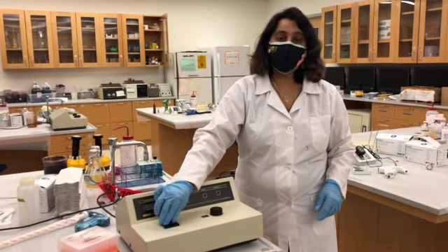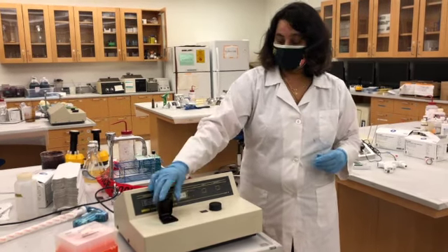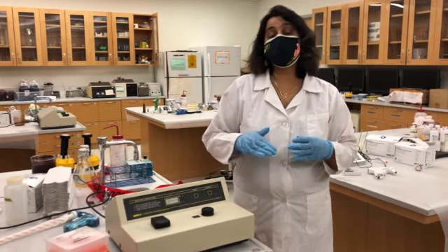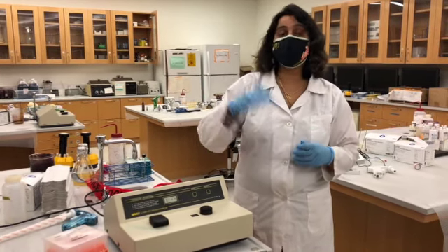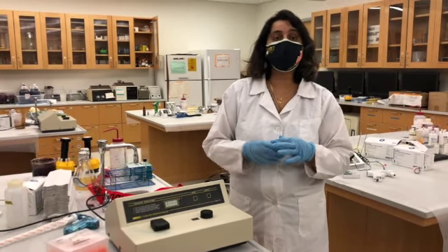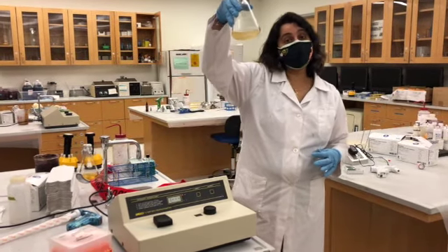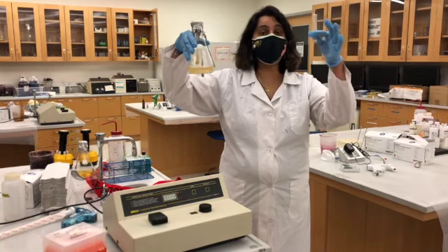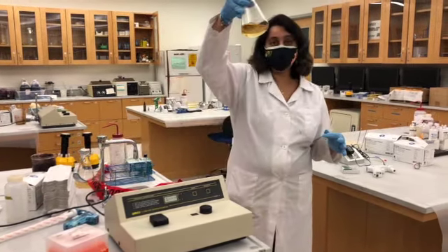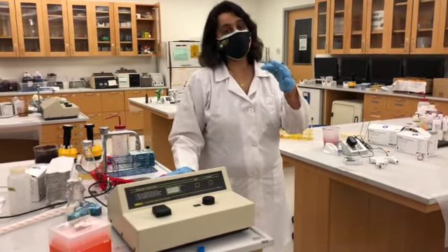Any instrument, before you begin your analysis, we need to blank the instrument. Blanking makes sure that you are taking care of any background noise or the background readings that you get from the other liquids that you use. Because we are growing bacteria in a media, for us the blanking should be with the plain media.